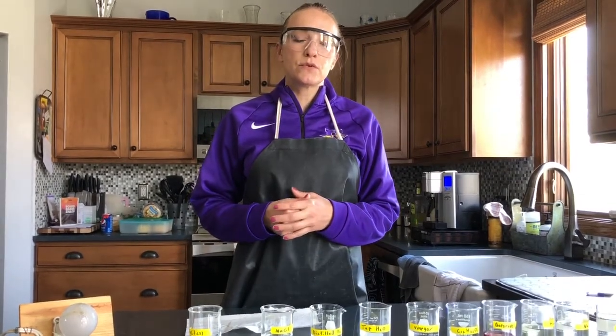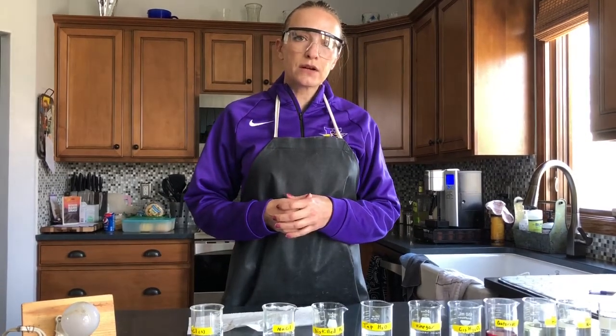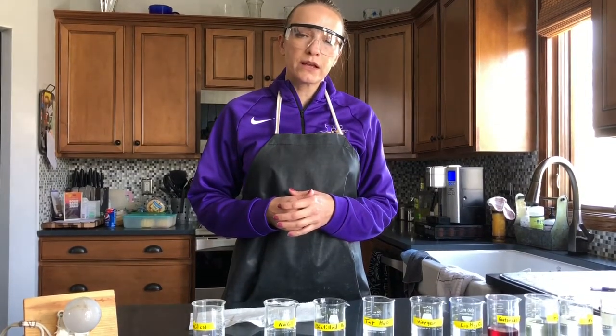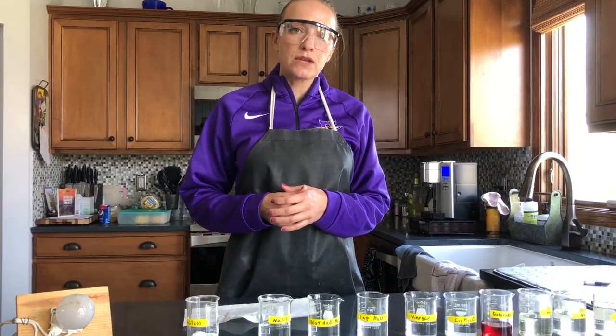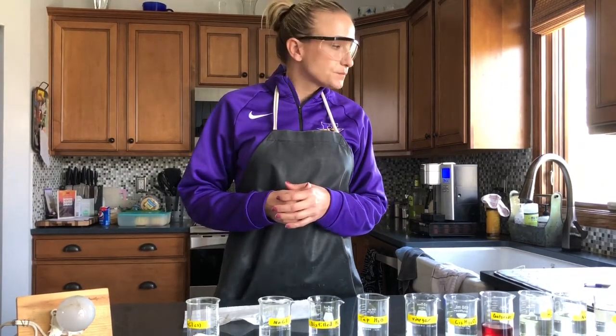We're going to work on the electrolytes lab today. You're going to want to have your electrolytes lab worksheet up on your Chromebook to record this data, or print it out so you can record it, or have some scratch paper so you can record what's happening with these different solutions, so that way you can later transfer it to your Google Doc lab.